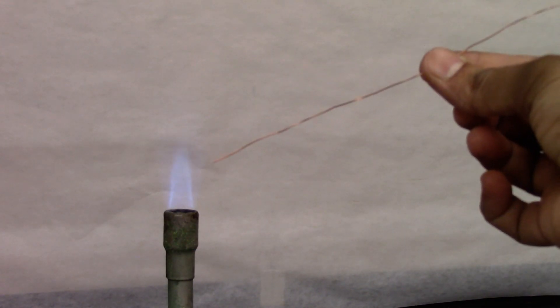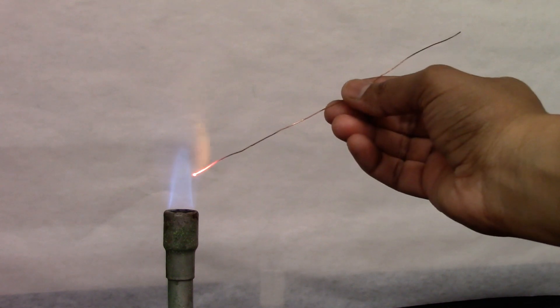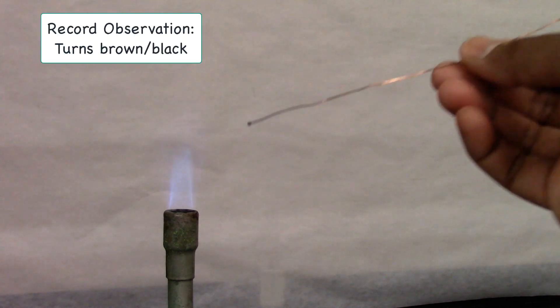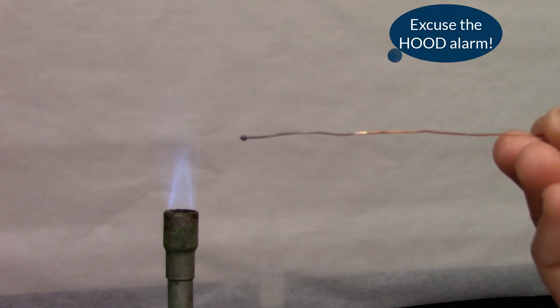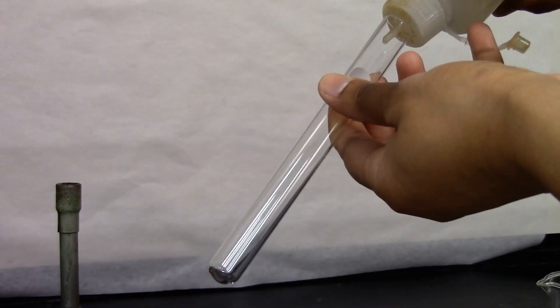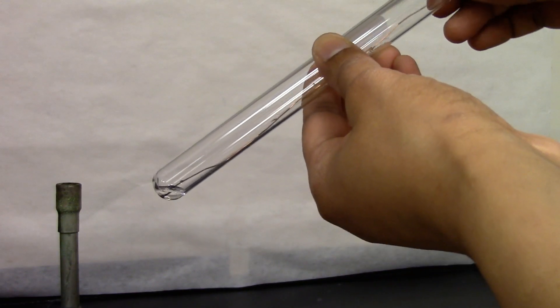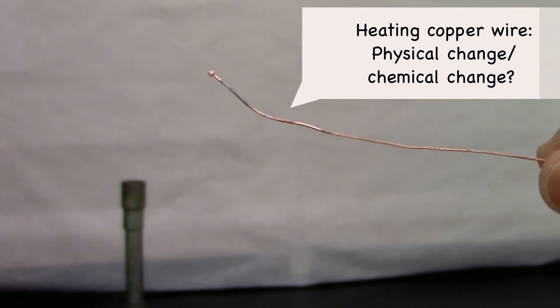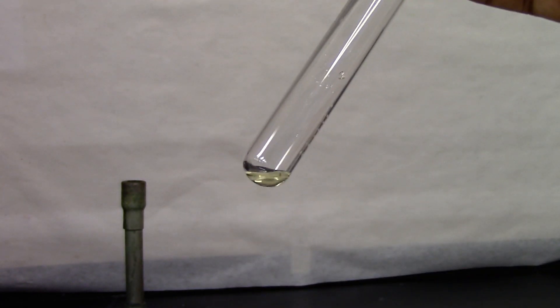I have a copper wire which I'm going to heat. This is how it looks after heating. Now I'm going to dip it into HCl solution. The HCl has turned pale yellow. The brownish tinge on the copper is gone, and the HCl has turned pale yellow.